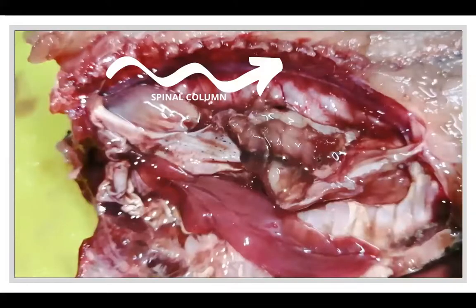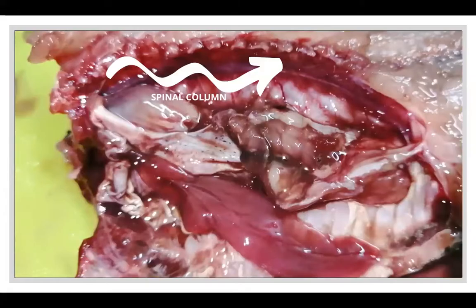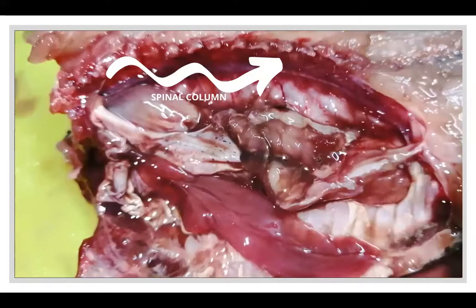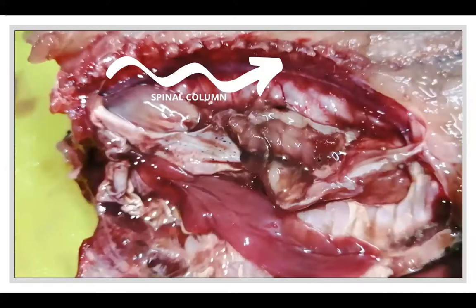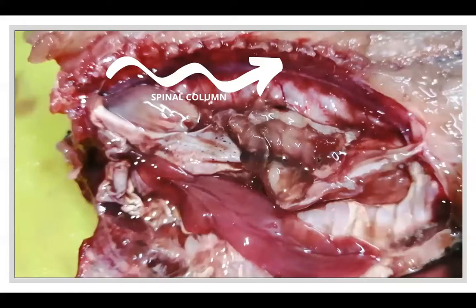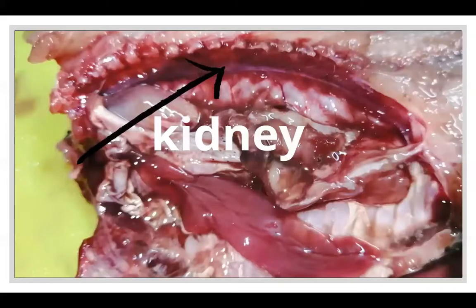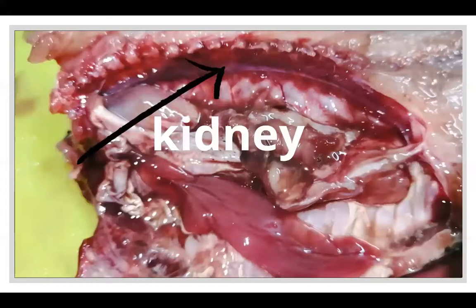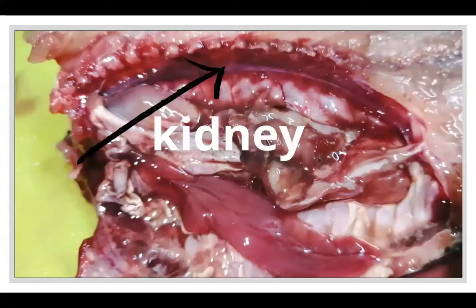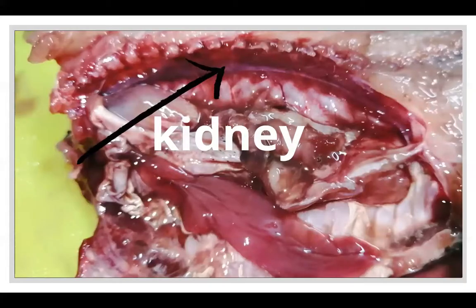The structural framework here is the spinal column. It is hard and consists of numerous vertebrae, which are hollow. It protects the delicate spinal cord and connects to the skull at the front and to the tail at the rear. This is the kidney, located at the side of the backbone. They are smaller and stretched and do not resemble beans; they help in excretion and regulation of water balance within the fish.